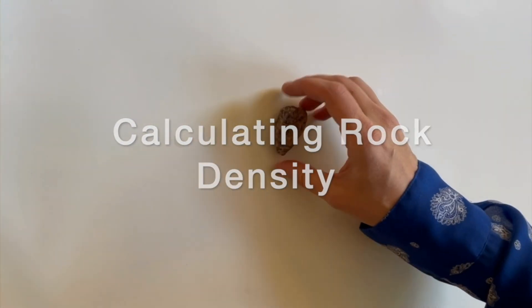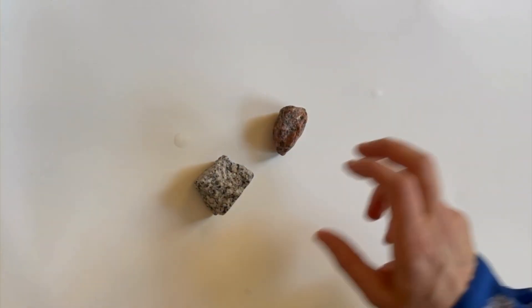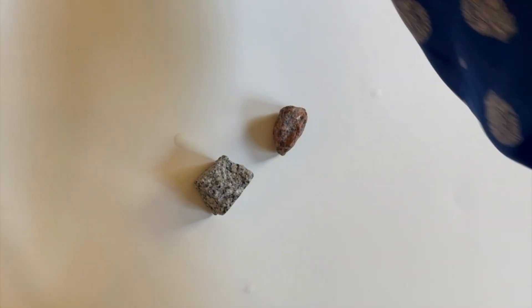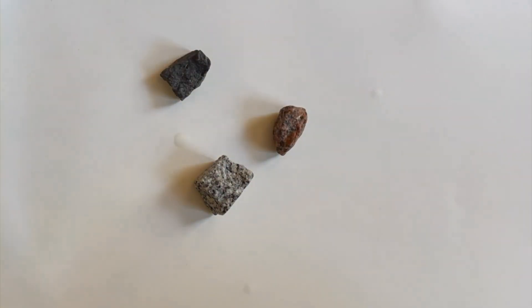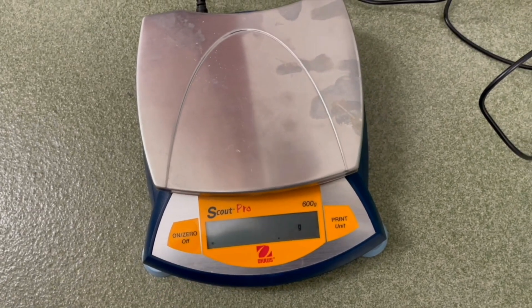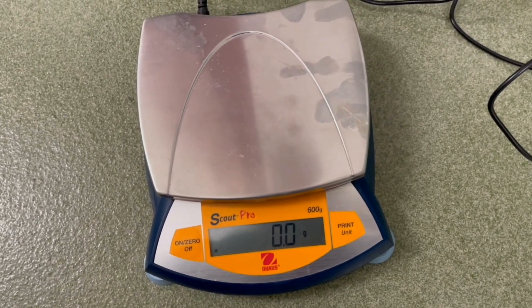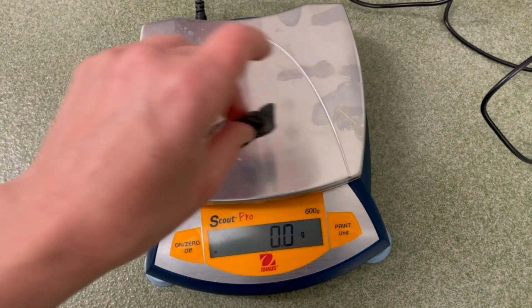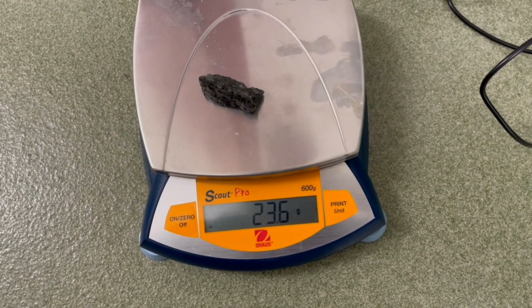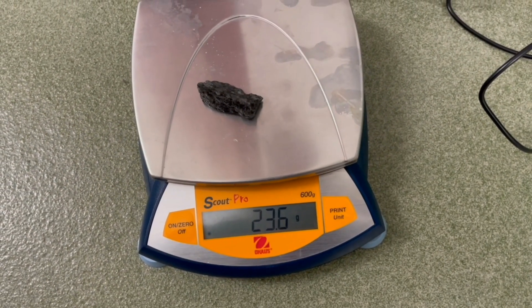This is the lab activity for Lesson 10 in which we calculate the density of rocks by measuring their mass and volume. Depending on the size of your rocks and the nature of your equipment, there are a few different ways to measure the volume. Since they all involve water, you want to take the mass of the rock first while it is still dry, since tenths of a gram do matter here.